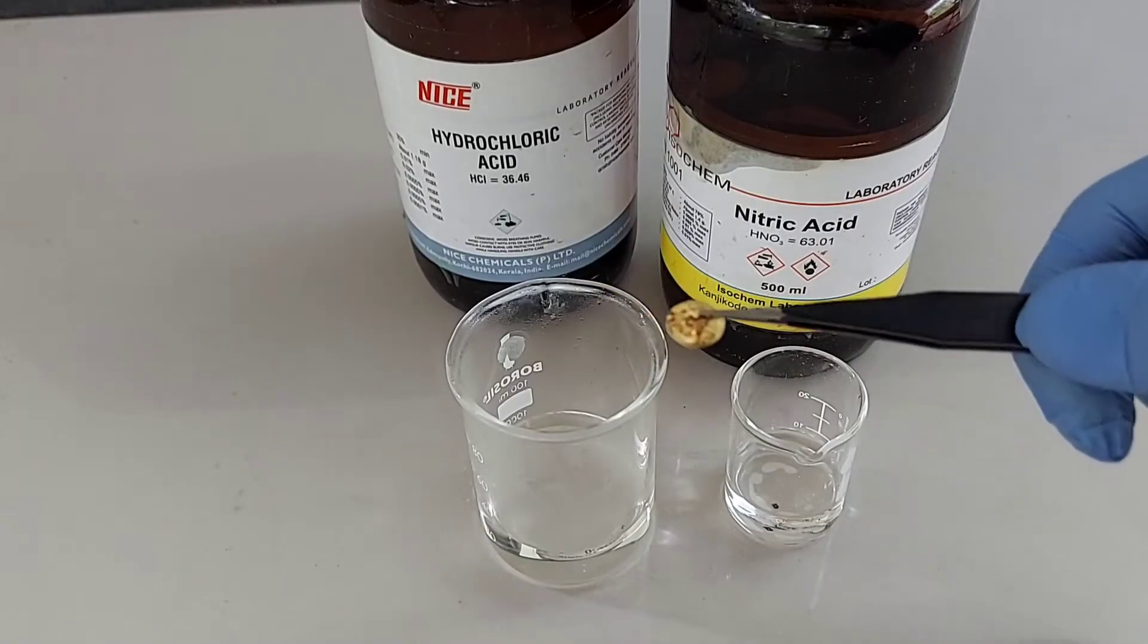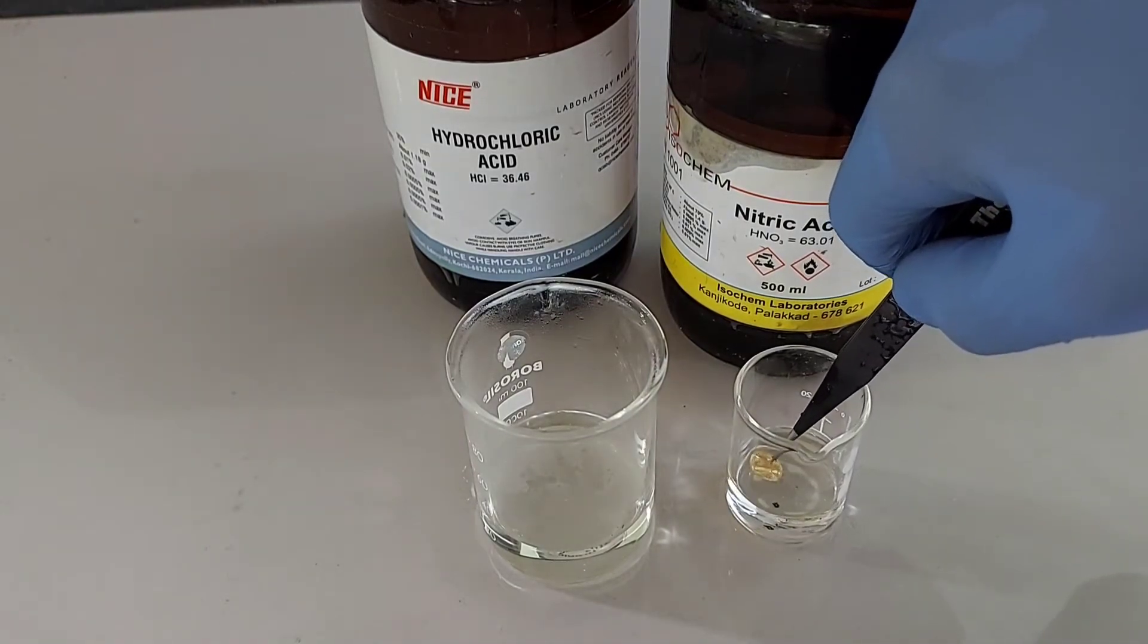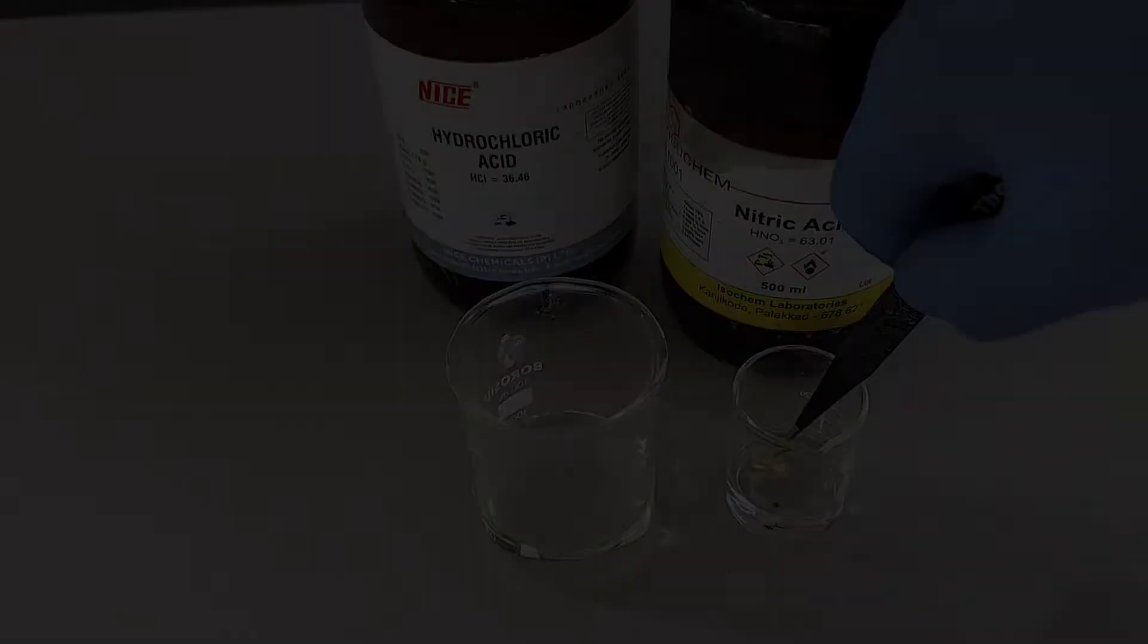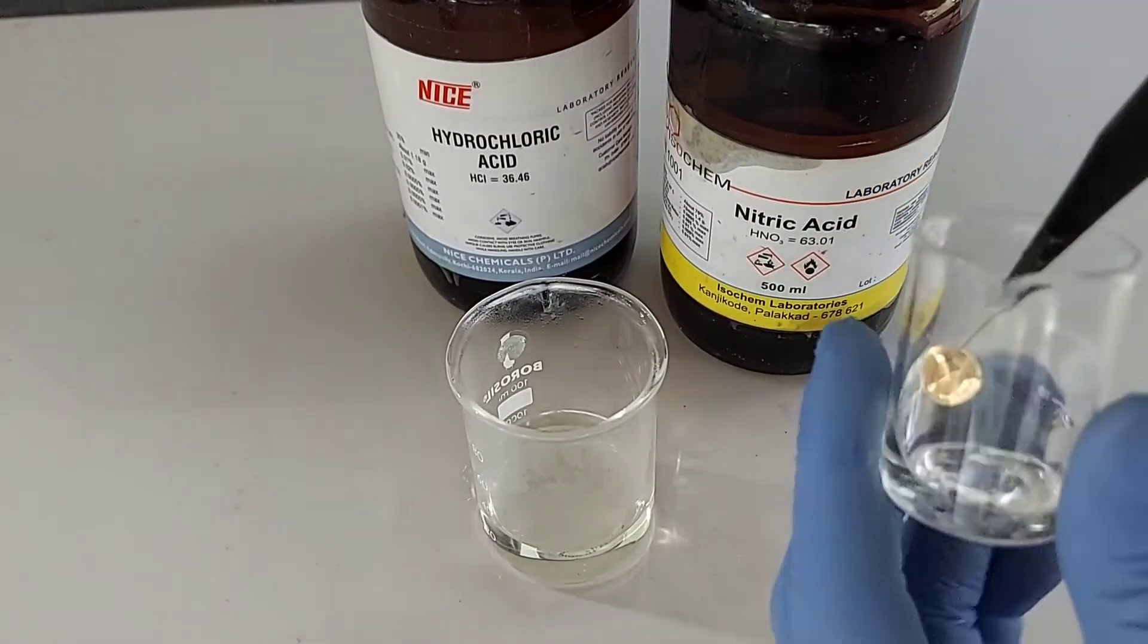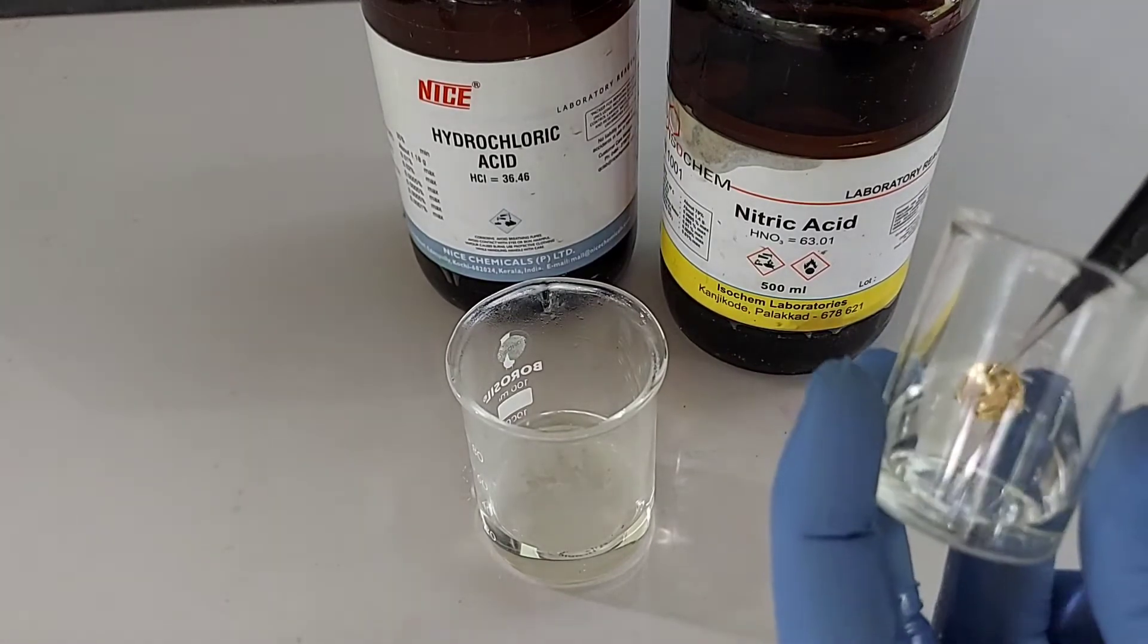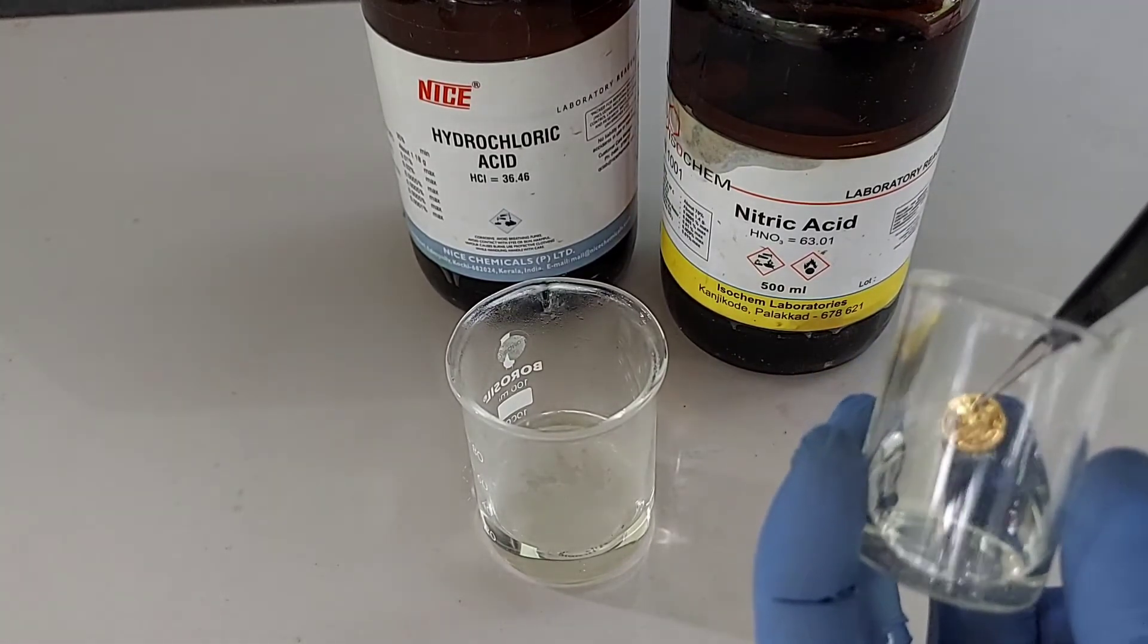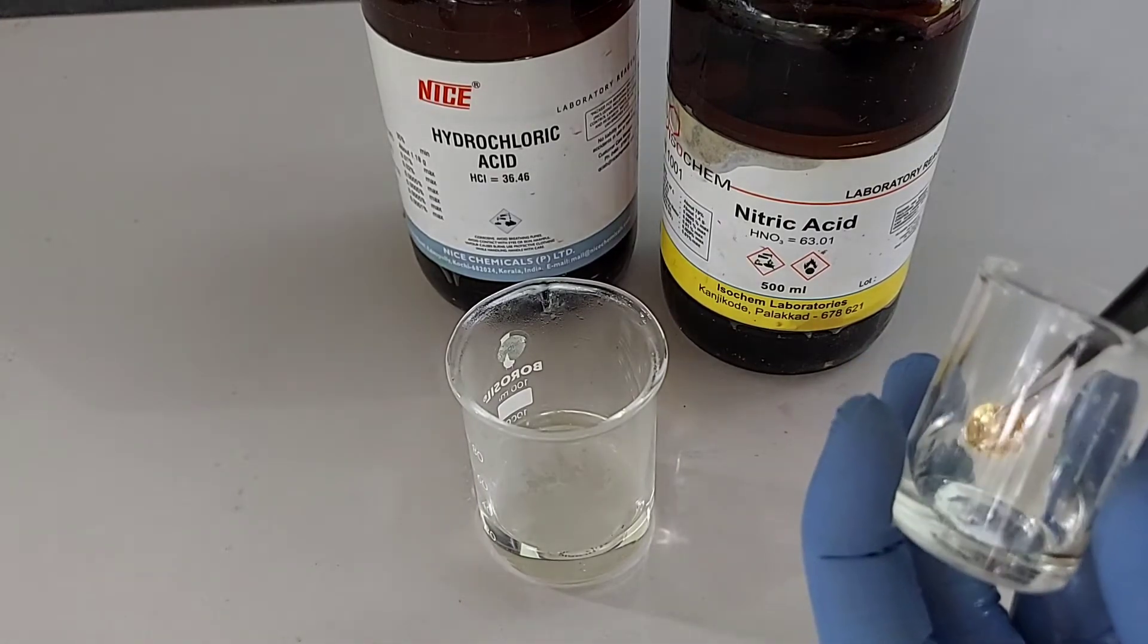We can also dip this gold piece into nitric acid. You can see after dipping this gold piece into concentrated nitric acid, it will not dissolve. Because nitric acid alone cannot dissolve gold. You can clearly see that here. No change is happening.